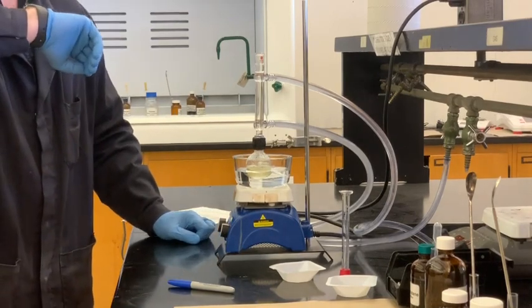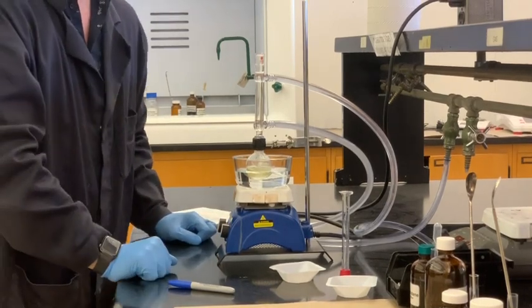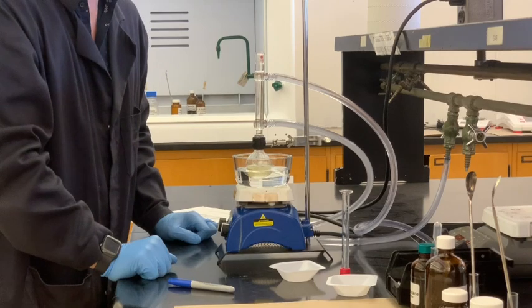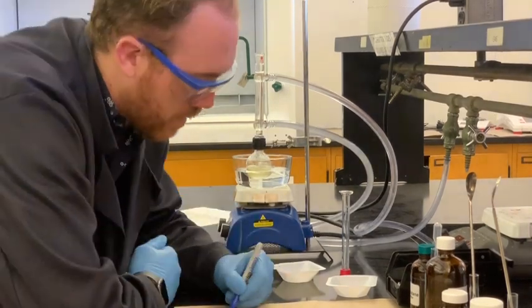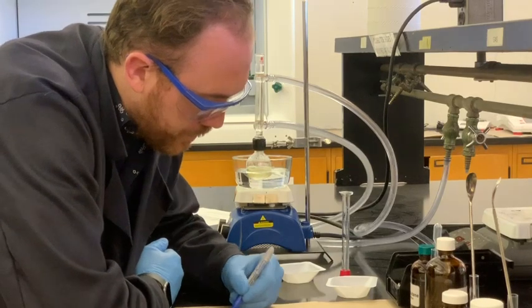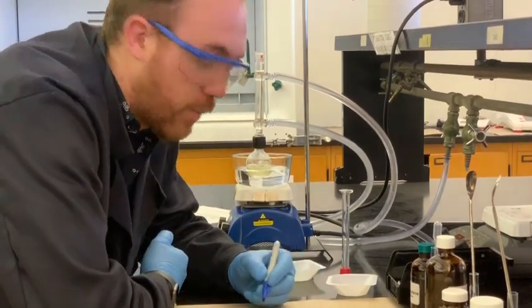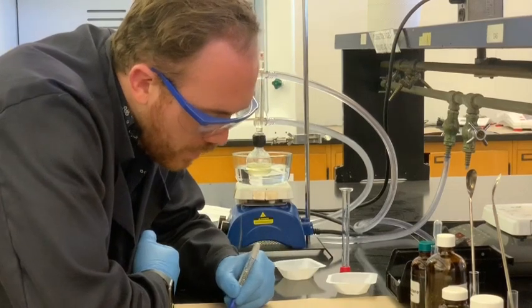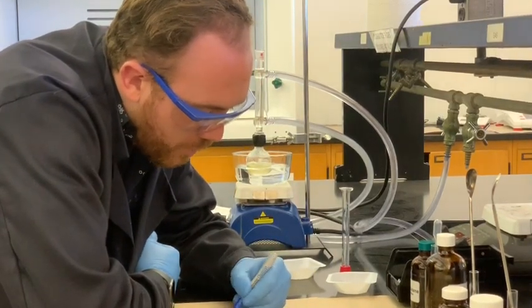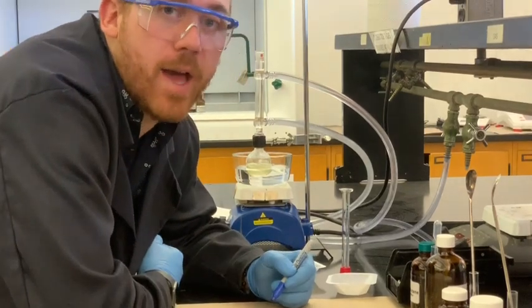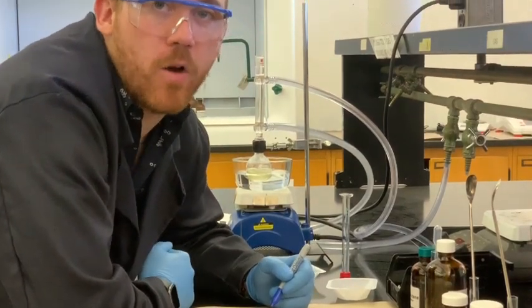Also, the reaction time to start is about 11. So we will consider that as our start time. It's 11:02, but we put the NaOH in a couple minutes ago. And in about half an hour, we're going to add in the bromobutane to begin our SN2 reaction.